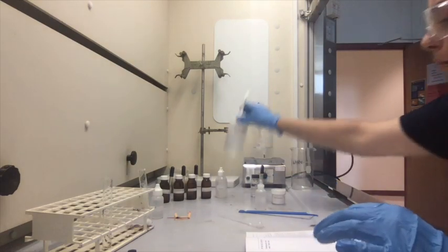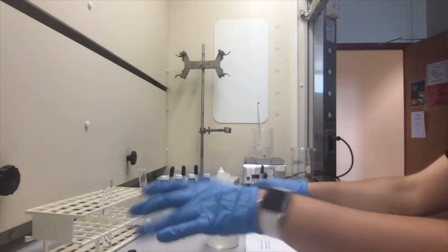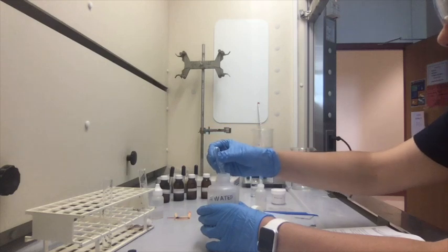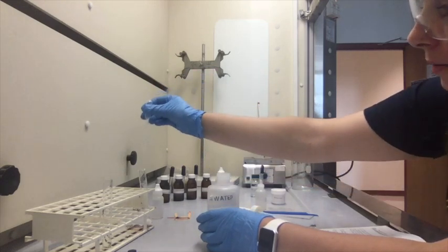So again with the water. And then we're going to add 2 mL. Like that.